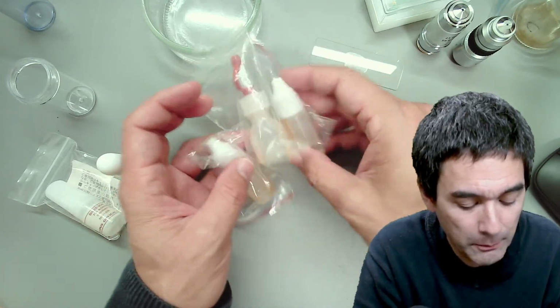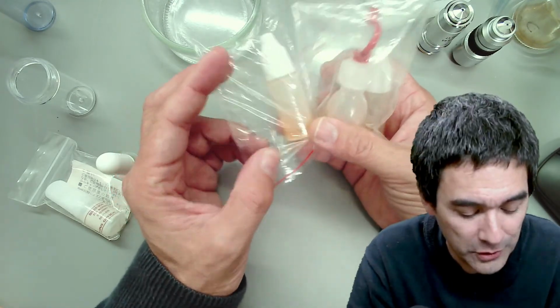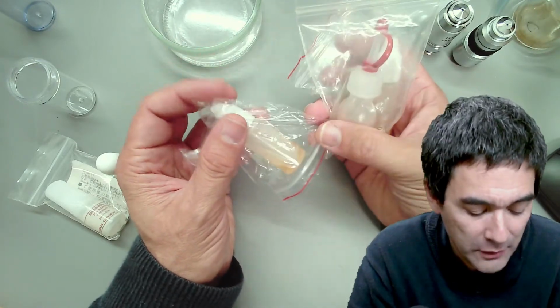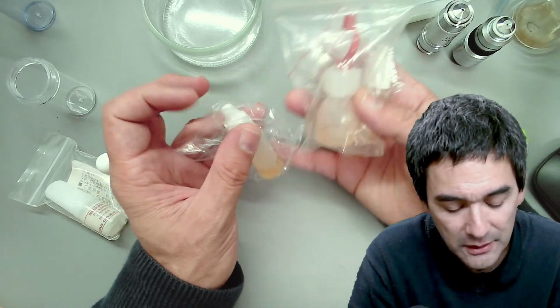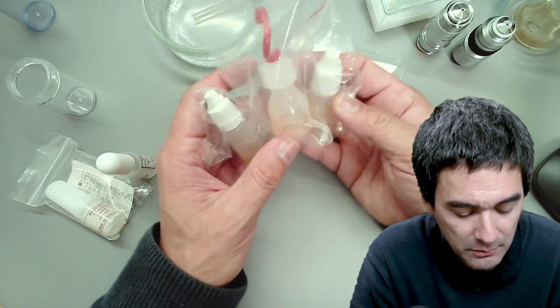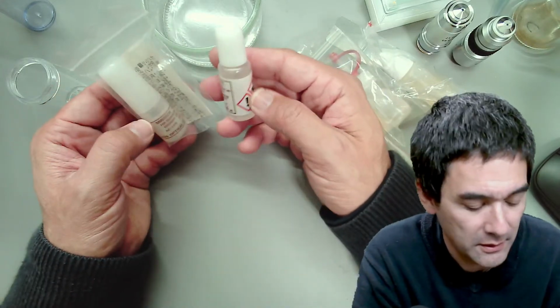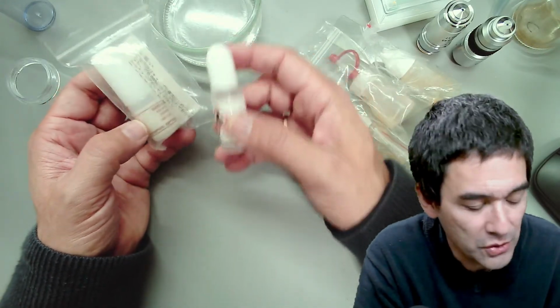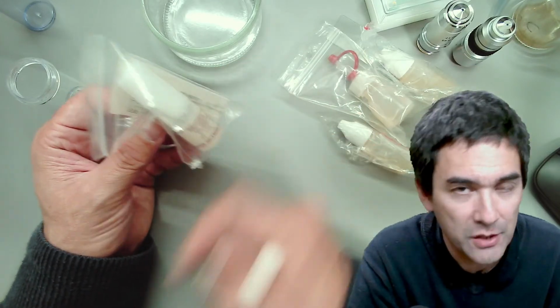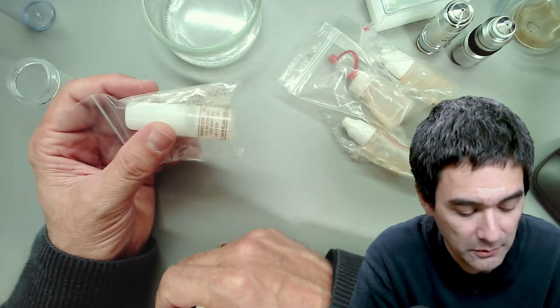Those three bottles came with some of the low-cost microscopes that I ordered. These are kind of no-name microscopes. When they have a 100 times oil objective, they come with a bottle like this. It's a little bit yellowish. And then these here are from the company Olympus, and that is the one that I'm using right now. And this bottle over here is almost 25 years old. This was from my previous microscope, and it's still good.